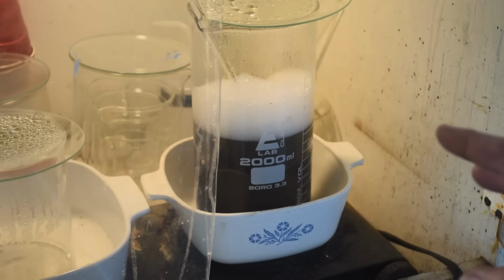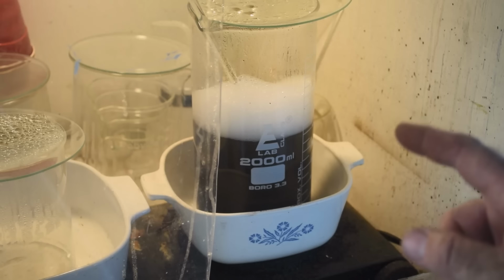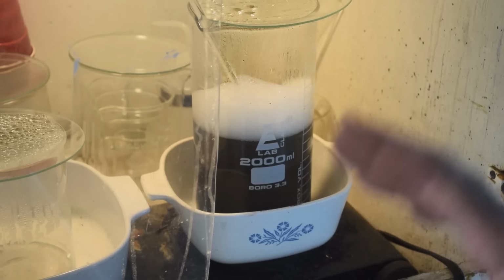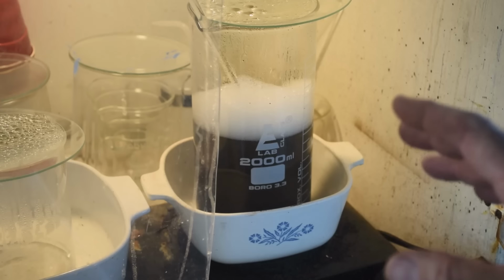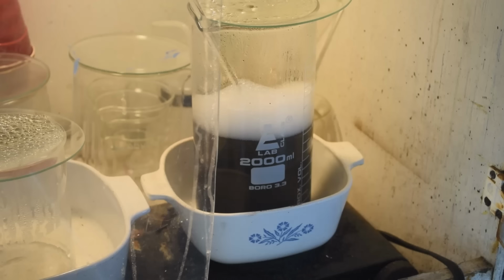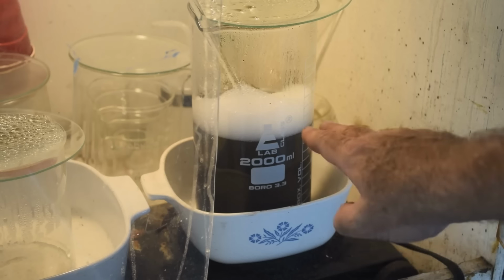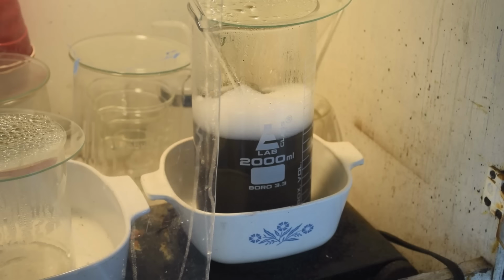I think what I'm going to do is take this off the heat. Let me turn the heat off first. Make sure both burners are off here. I'm going to take this off the heat and just let it sit and settle and see what it looks like in a half hour, 45 minutes or so. Maybe I'll go have some lunch and come back out and have another look at it. See if whatever's fine metal is in the water column settles out and the liquid clears up. It really does look like it's trying to clear up. So we'll just let it sit and settle and see what happens.